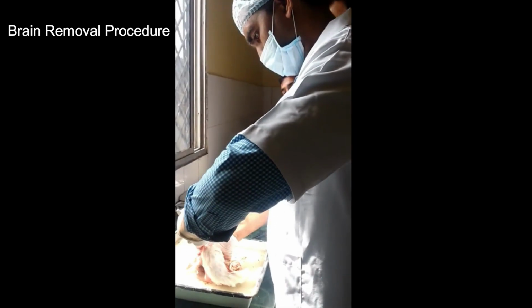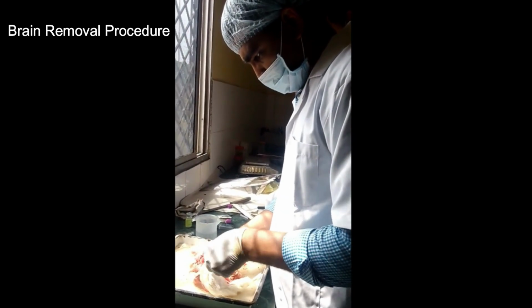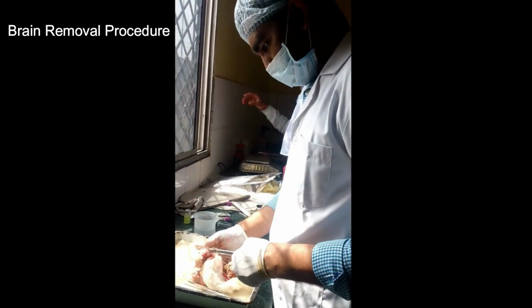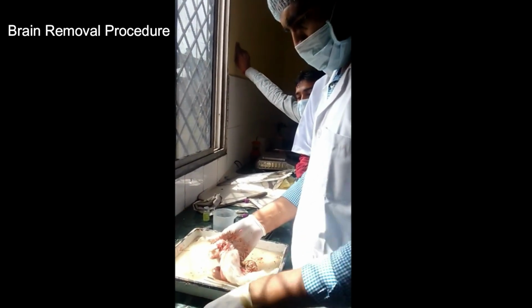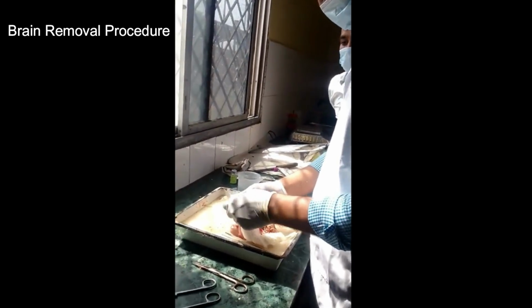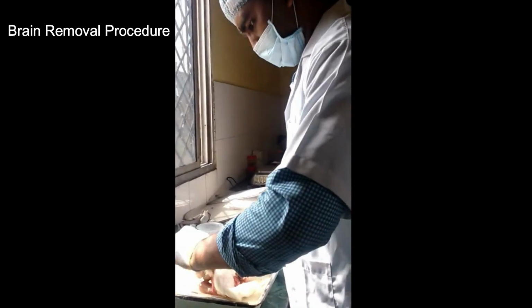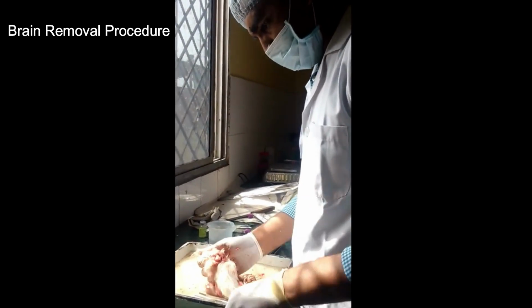At last, the final procedure is removing the brain. This is the most delicate step. First, carefully remove the eyes, and remove the skin covering the head region. Using scissors or bone cutter, slowly break the skull from both sides. Gradually lift the skull cap. Carefully separate and remove the brain. Ensure the brain remains intact without any damage. These steps require precision and skill.